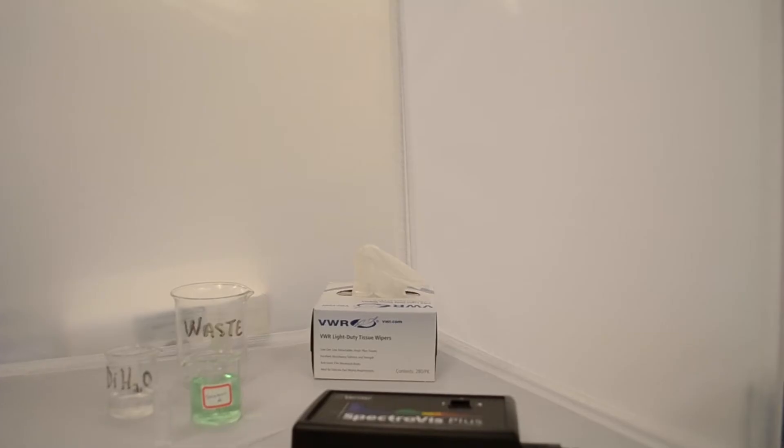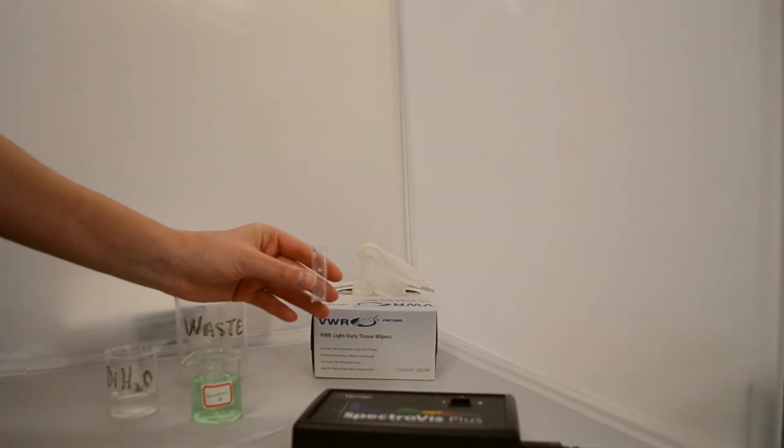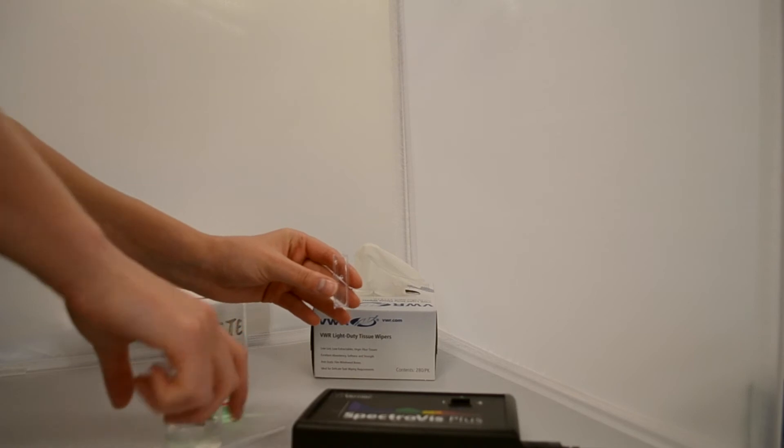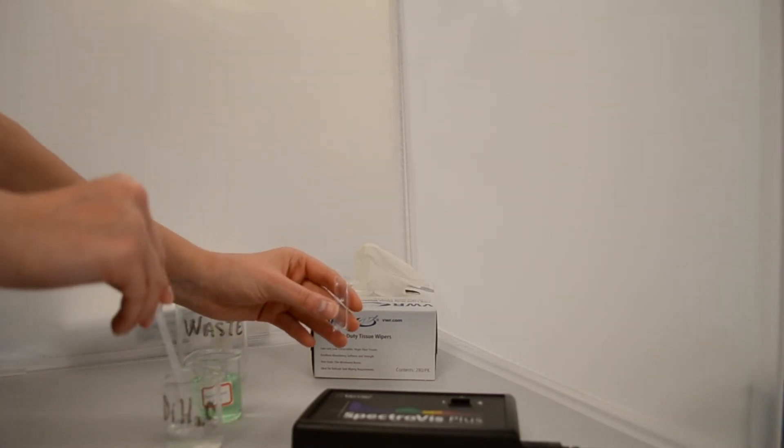A blank cuvette will be used to calibrate the spec. Use a transfer pipette to fill the cuvette two-thirds full of DI water. You will use DI water in your general chemistry classes.